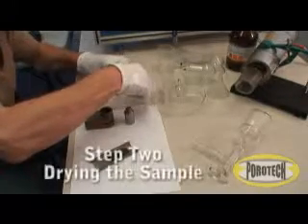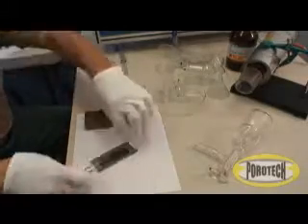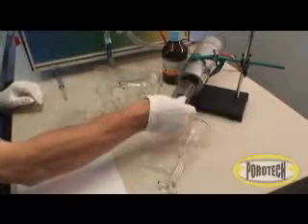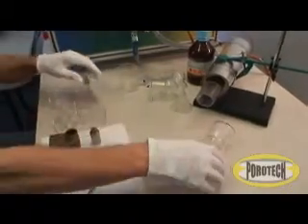Step 2. Drying the sample. Prior to testing, we need to ascertain the absolute dry weight of the test sample and the two reference standards. The drying process begins by putting the test sample and the two standards on the tray and into a heated vacuum chamber.